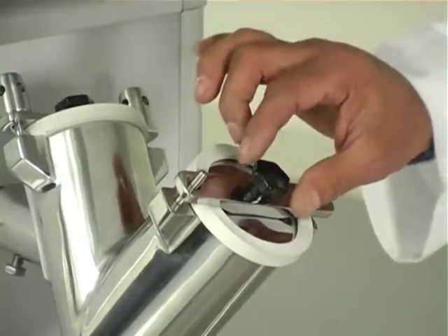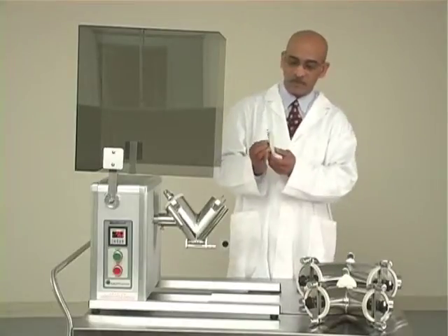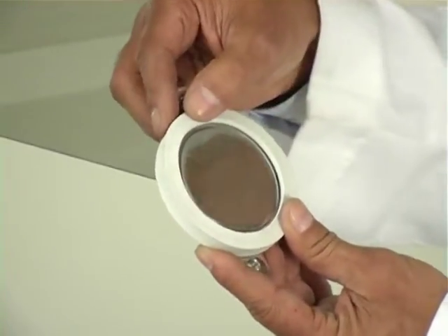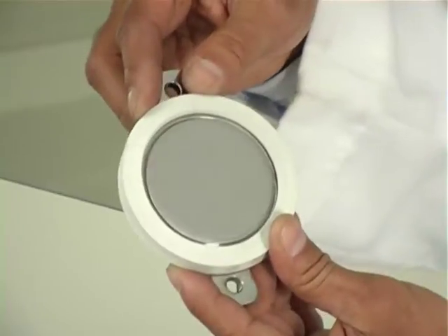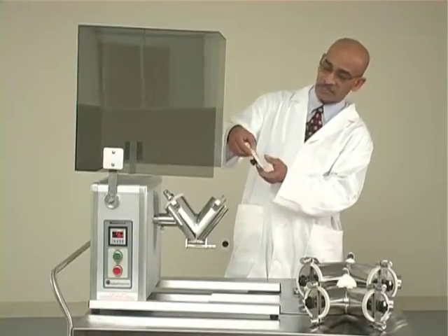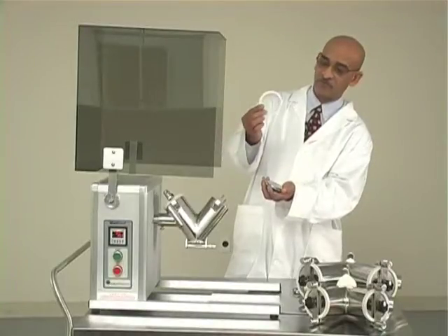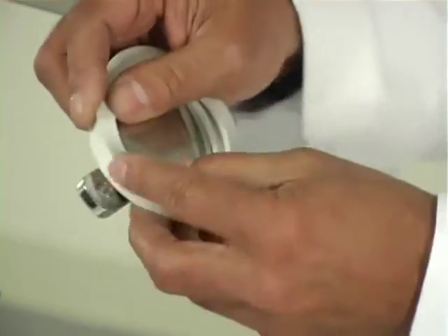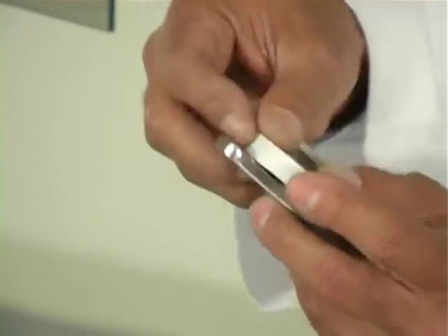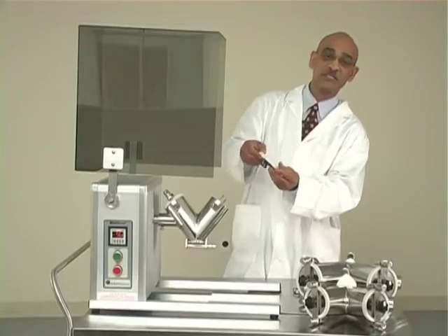Once the thumb nuts are removed, using this knob you pull the cover plate completely out. Each cover plate has a gasket made of FDA-approved white nitrile or FDA-approved white neoprene rubber. This gasket can be removed completely for washing purposes. To install the gasket, you just install it around the edge of the cover plate — it is kind of tight, which it is supposed to be.